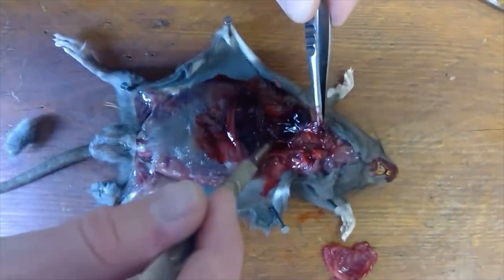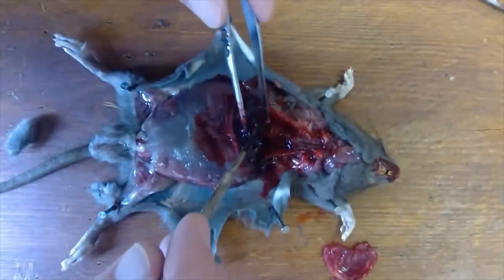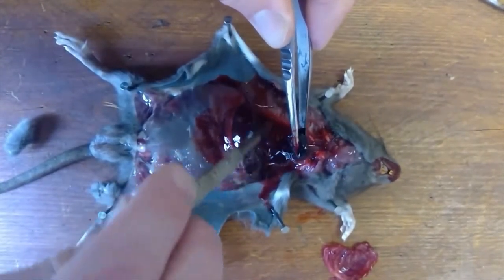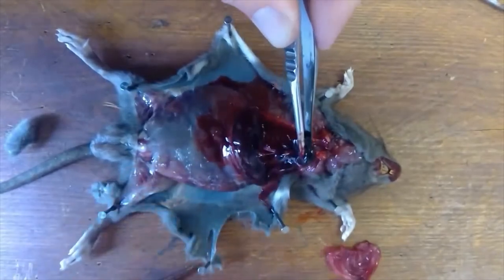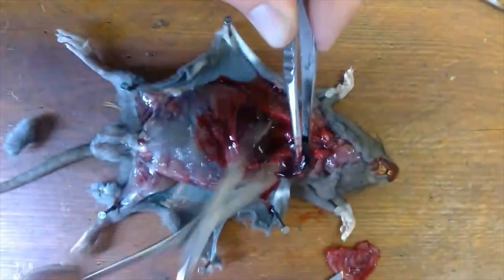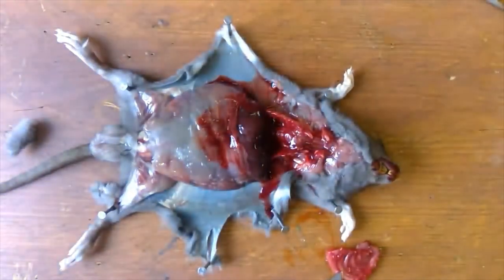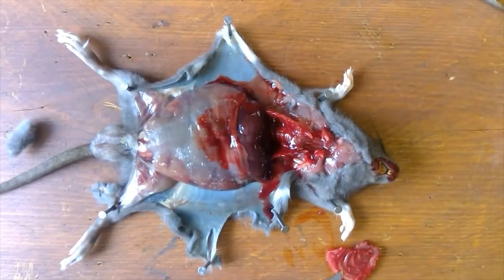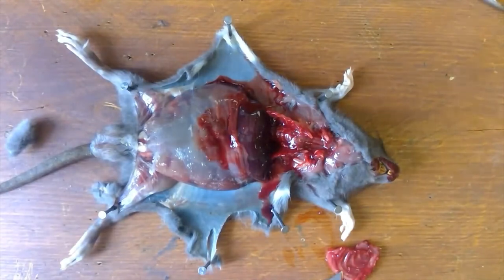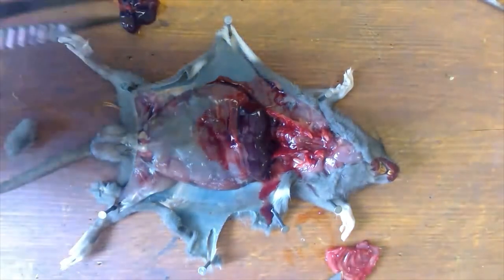There we can see the aorta — the largest blood vessel in the body — going back over from the heart down through the spine, feeding the organs with oxygenated blood. I'll grab it by the heart. And that is the heart and lungs — I'm just going to dip them in some water, which allows us to see them slightly better.